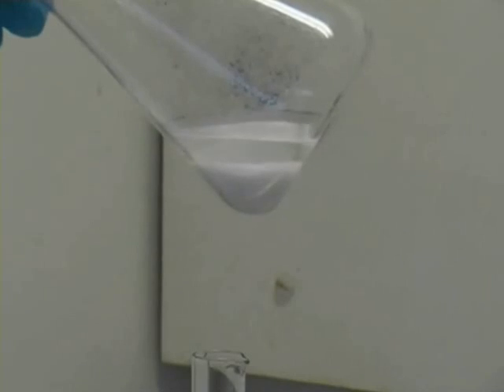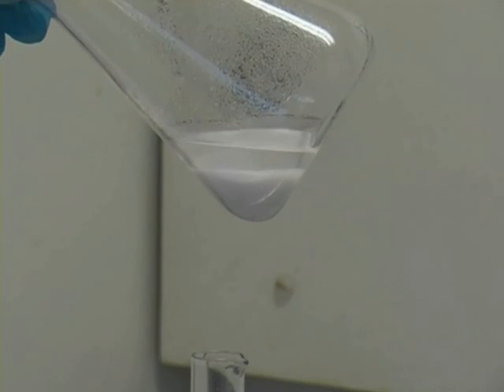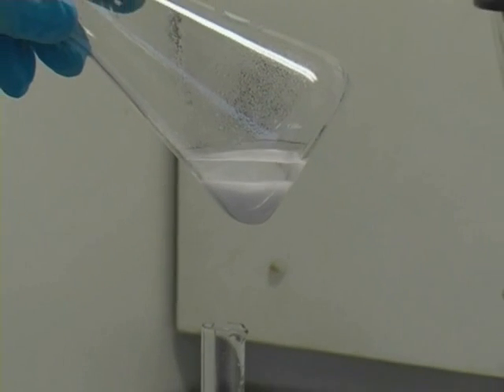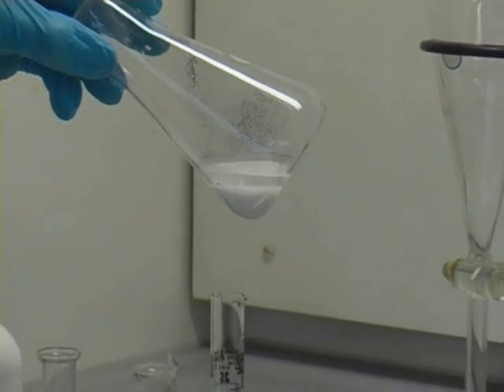Remove the drying agent by gravity filtration through glass wool and then remove the solvent using a rotary evaporator.